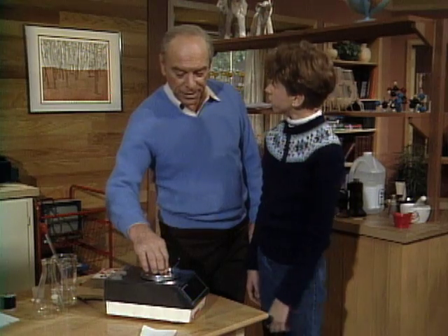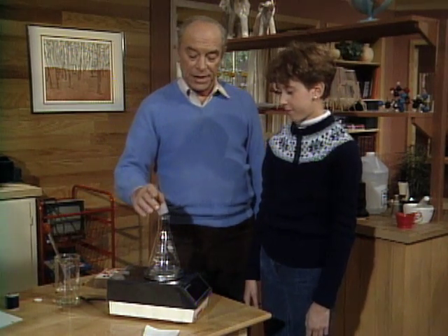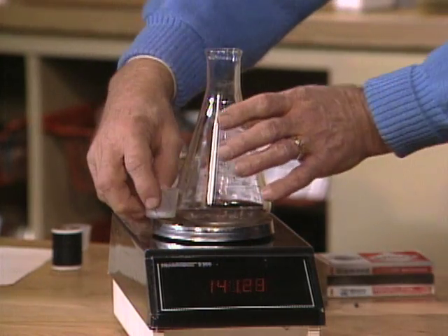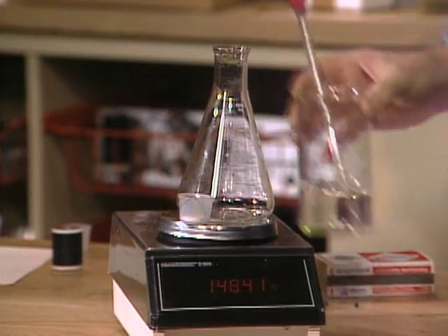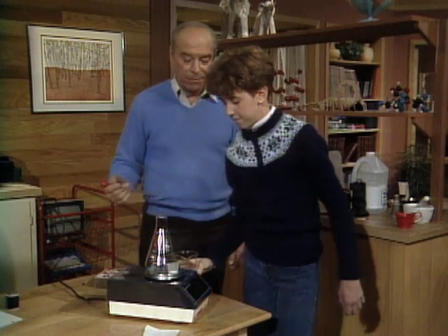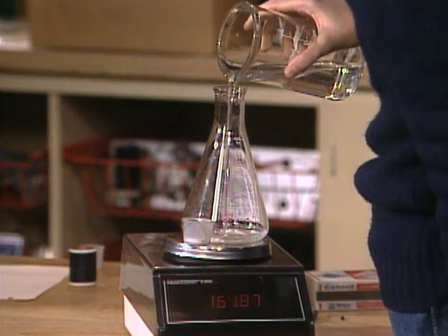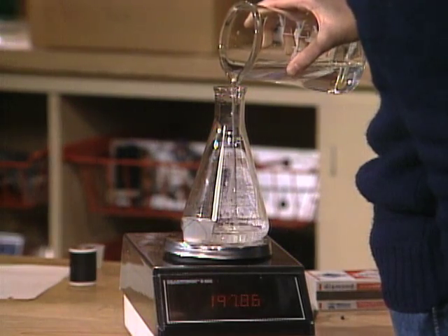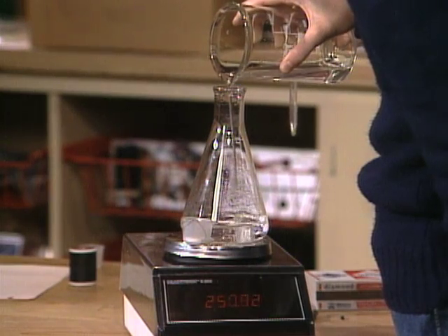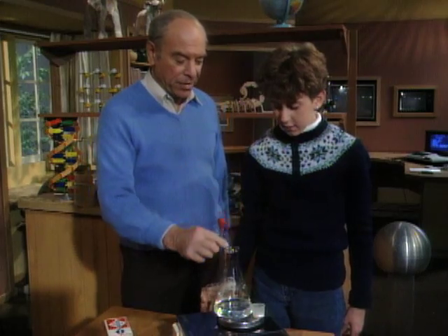Now I have a sort of nice little challenging puzzle for you. Here is a flask, here's a stopper that goes in the flask, and here is a headache tablet. I'm going to put this off to the side, and I want you to get as close as you can to having that whole group weigh about 300 grams by adding water. It's at about 148 now, so I have about 150 to go. Stop just short and then you can use this medicine dropper to get closer.